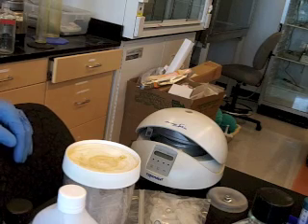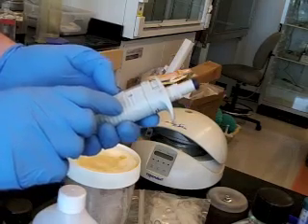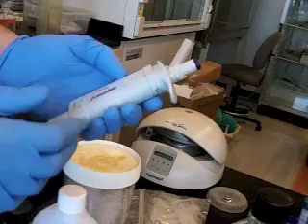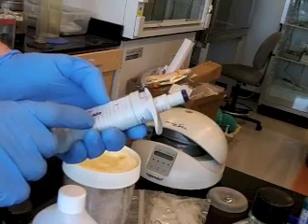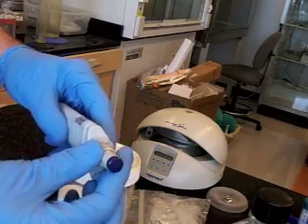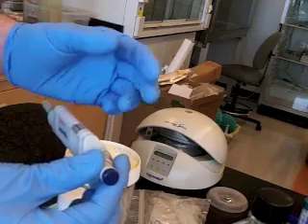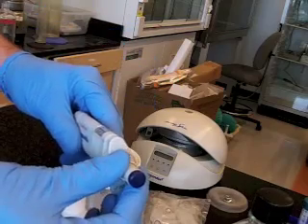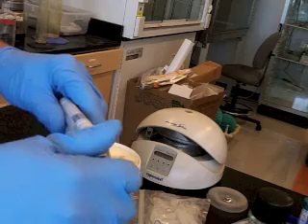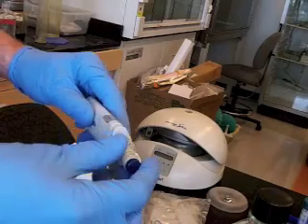Then here's some micropipettors, and there are a variety of different brands, and they all have the same features. The first feature to mention is that the gears inside of these are always made of plastic. They could be a super premium micropipetter, and the gears are plastic. There is a way near the handle to adjust the volume and turn those gears. And in turning the gears, you want to just keep in mind they're plastic. If they ever jam, which they sometimes do, you want to be gentle and sort of toggle things back and forth and try to release them, and not just crank it. Because if you crank it either in a jammed micropipette or at the end of its limits, you'll just destroy the plastic gears.